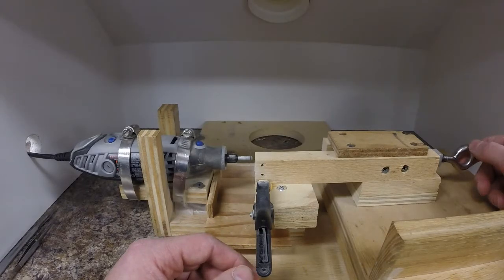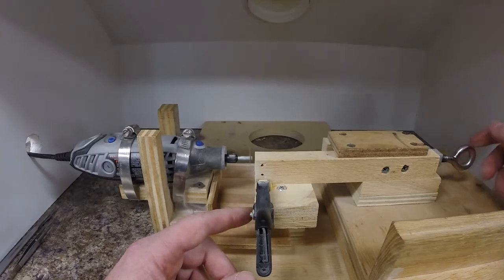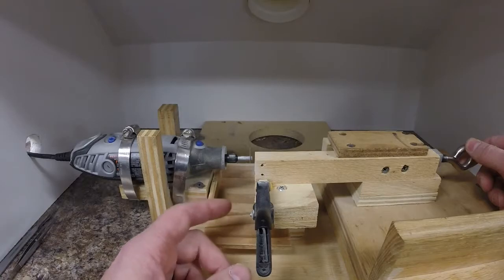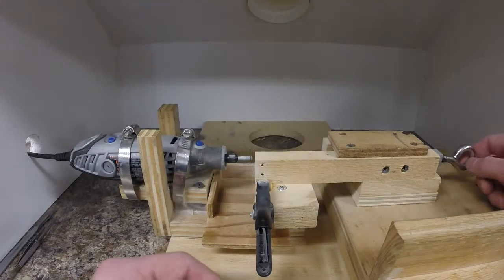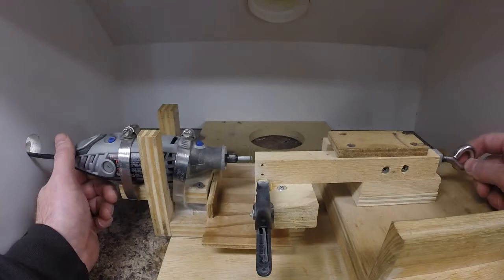For example, when I do most of my sectioning, I'll clamp it in, make the first cut, and then turn the screw half a turn, make a cut, three quarters of a turn, and then five eighths of a turn for my three sections. With most structures that I section, one of those three thicknesses will work for aging.